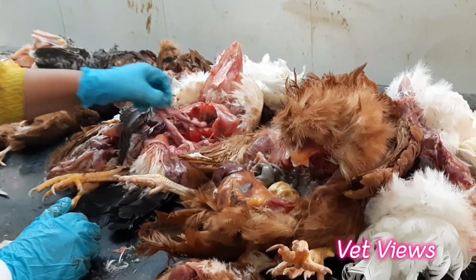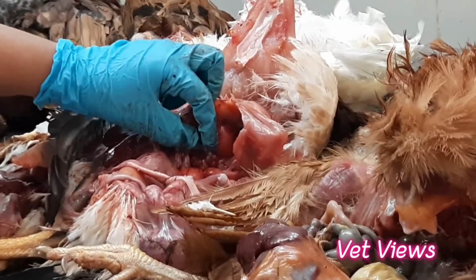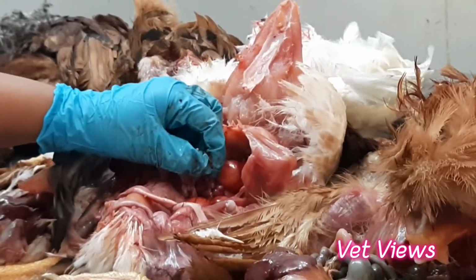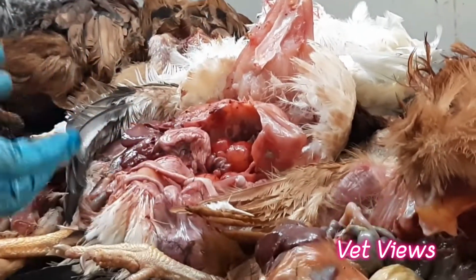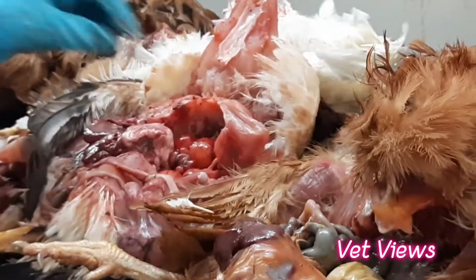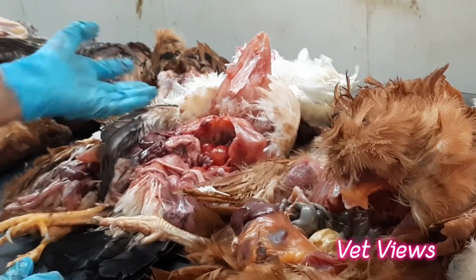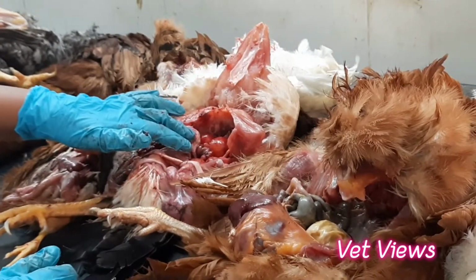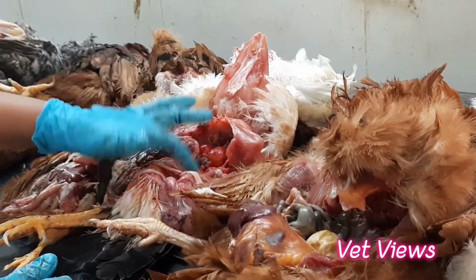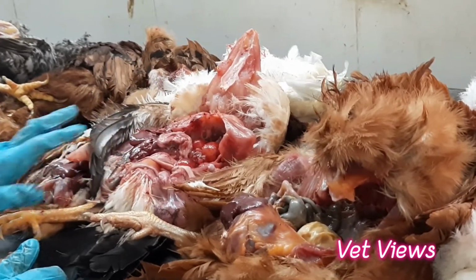And in the ovary, this is a normal ovary. Sometimes whenever there is an infection like salmonella or pasteurella, the ovaries become very pedunculated. It means the stalk will become very long, and it will be more hyperemic. Here the congestion is because of postmortem changes, whereas there it is because of infection. Those conditions you have to observe in the reproductive organ.